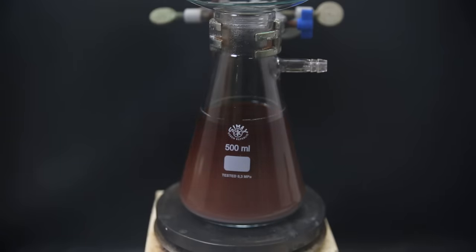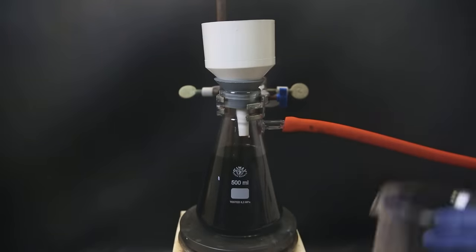I move it to a beaker again and wash it out with some methanol. I then filter it all through a filter paper and let it dry on the filter for a few minutes. The residue is a dry grayish cream-colored solid and I scrape it off the filter. Adrenaline is quite sensitive to oxidation from the air and also through light and it will relatively easily convert into adrenochrome, which has a purple color, which is why adrenaline discolors easily. The yield of racemic adrenaline turned out to be 4.1 grams, which is 88%, while theirs was only 64%.